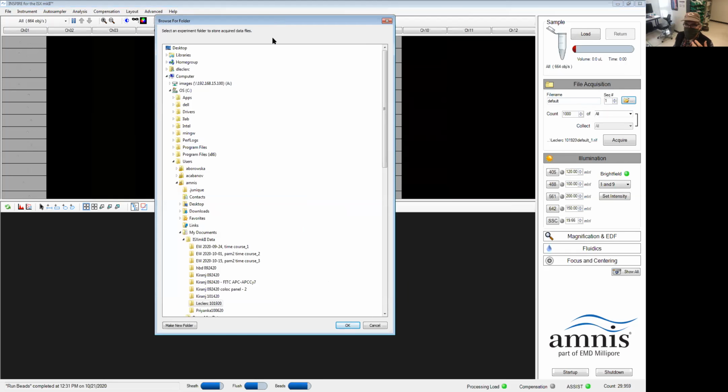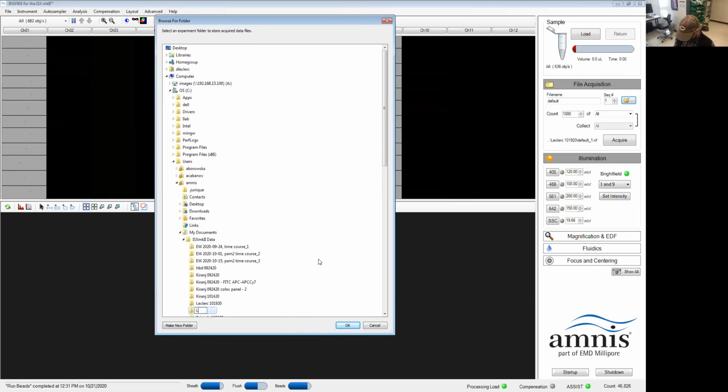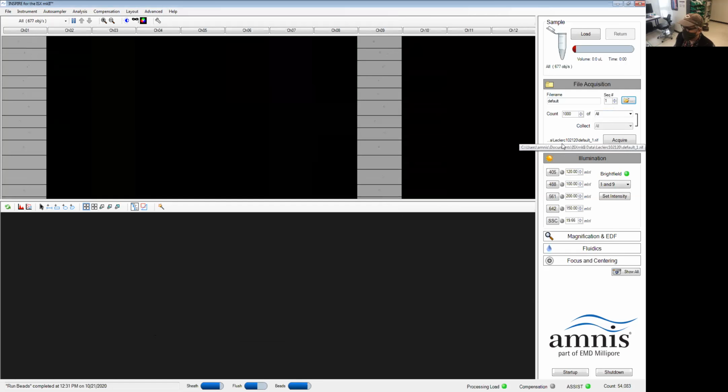Now, to be able to transfer your data on the server automatically, we recommend saving the data on the C drive, user, amnis, My Documents, ImageStream MarkII data. Whatever ends up in this folder gets pushed to the server every half hour or so. We're going to make a new folder here with my name, today's date. And that's what we'll have over here.